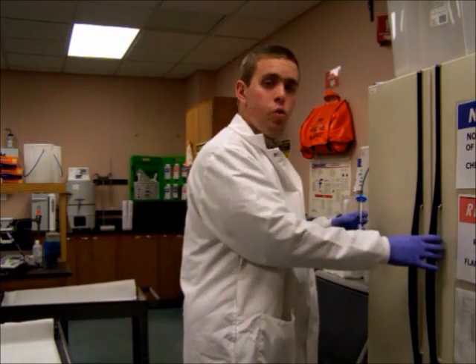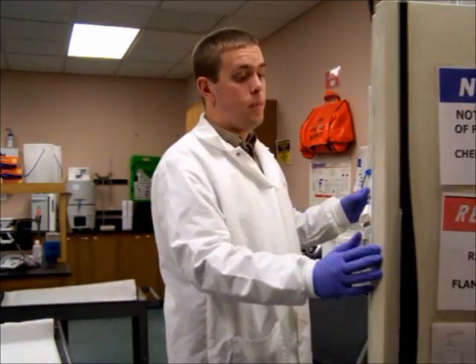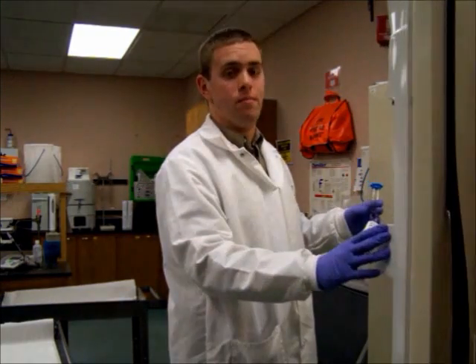Follow your work. Make sure that you store your material in the research fridge in room 304 in the appropriate section.